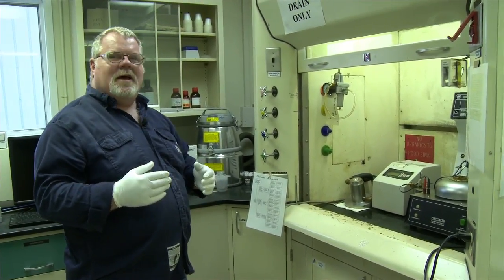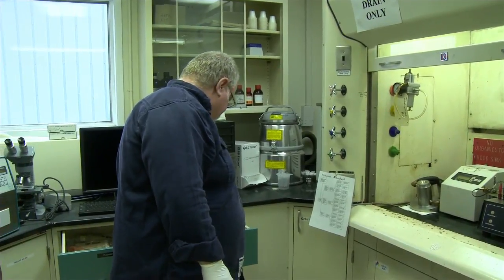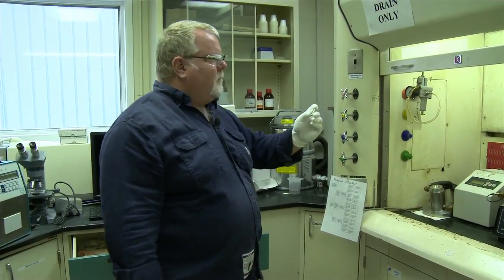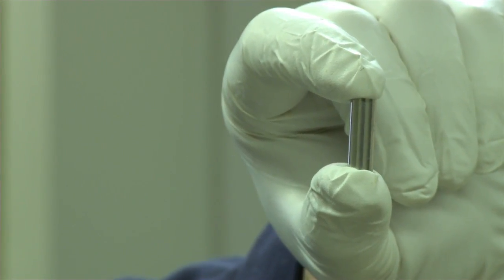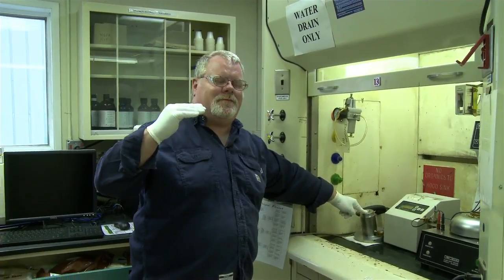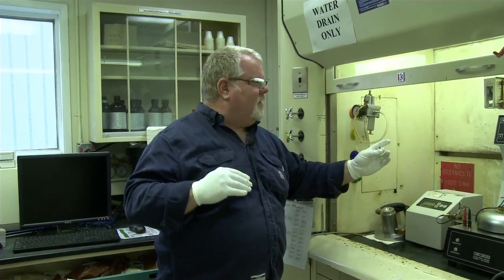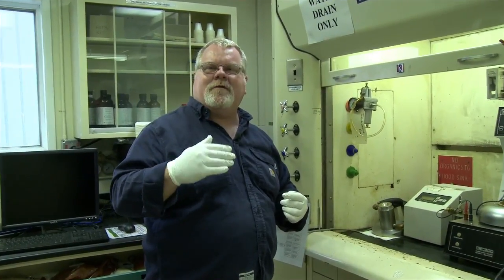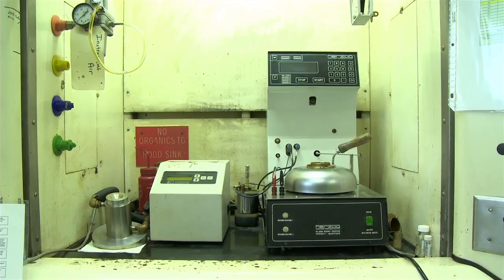It essentially has a cylinder, different sized cylinders like this, which go in this little cup here, and then a radio frequency magnet will draw this up and down through the oil, and then the amount of resistance is based on the time it takes to travel, and it calculates the viscosity based on that.